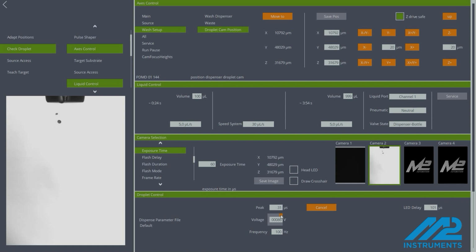Select the setting that allows for stable droplet dispensing. Try to avoid small droplet satellites. The parameters are interdependent, requiring multiple adjustments before achieving the optimal configuration.